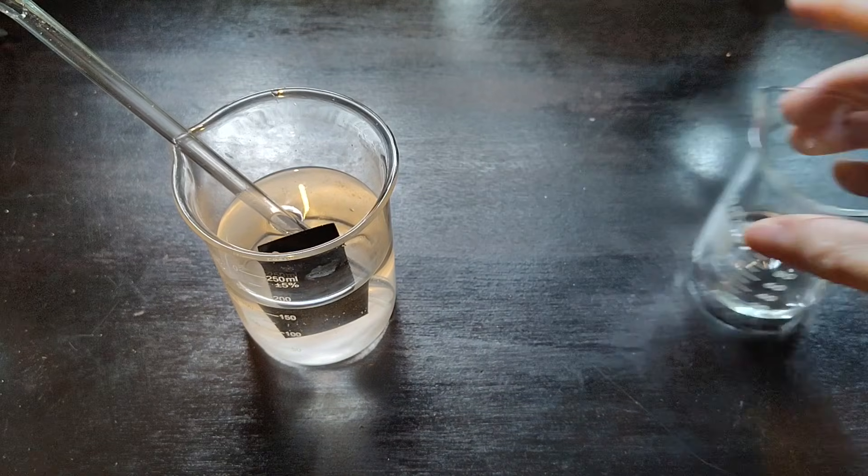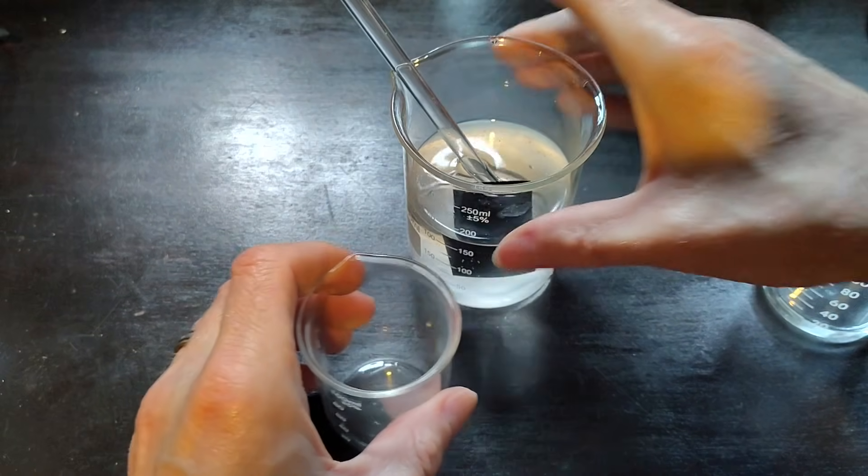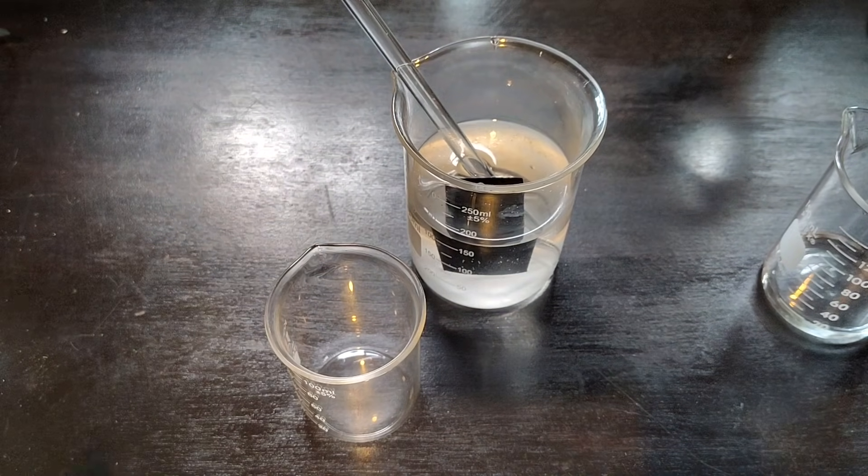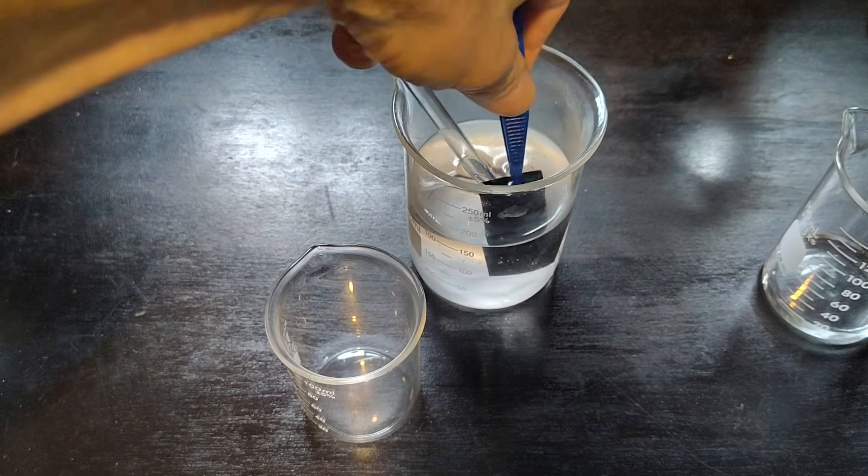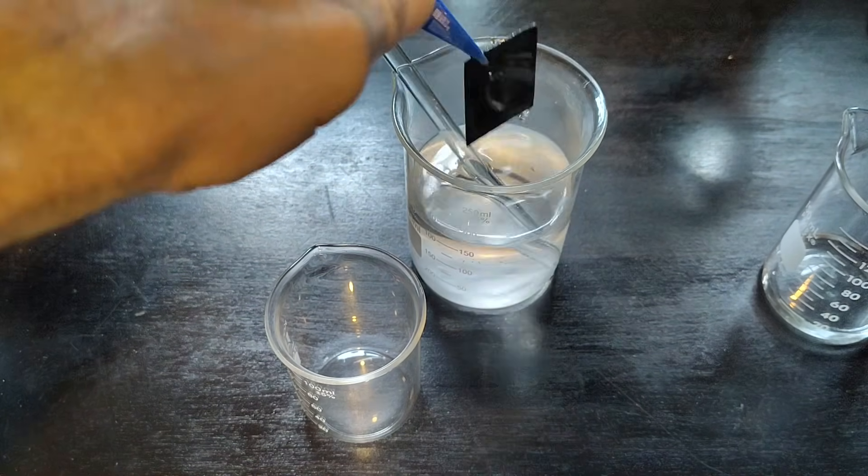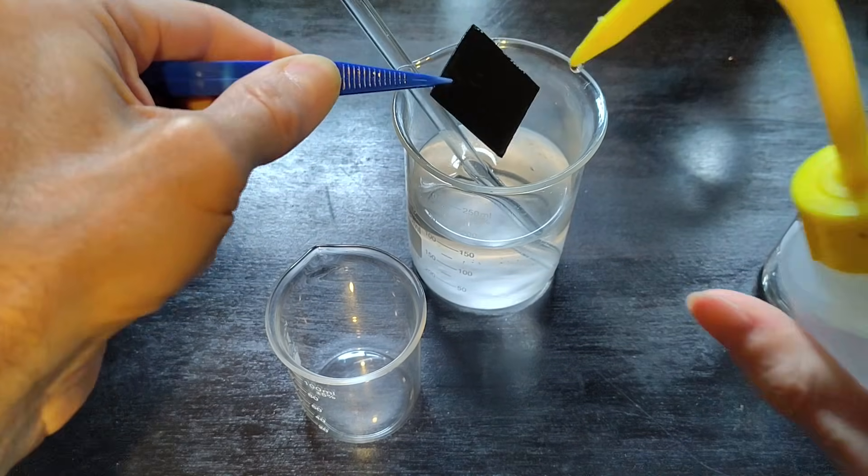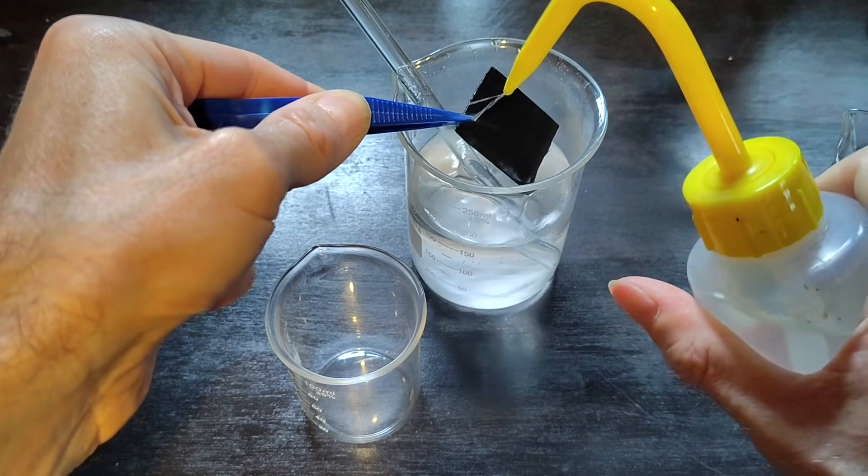And now that it has been neutralized, just take it out of the solution and rinse it with distilled water.